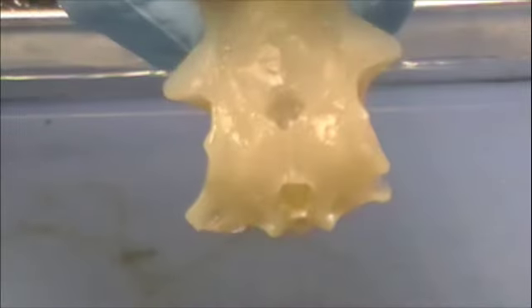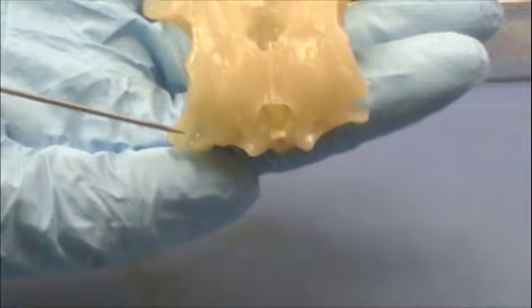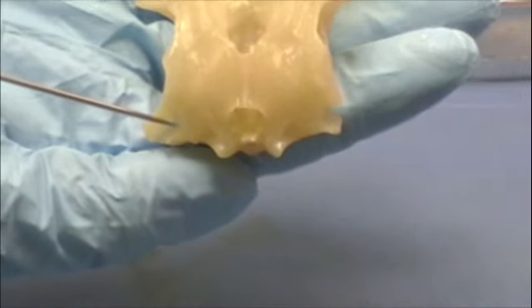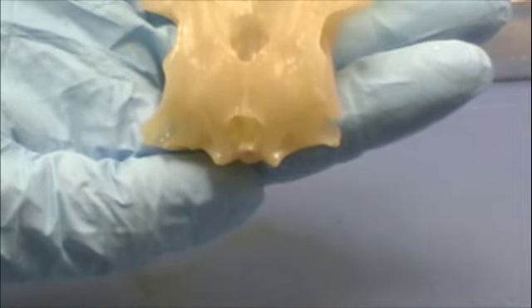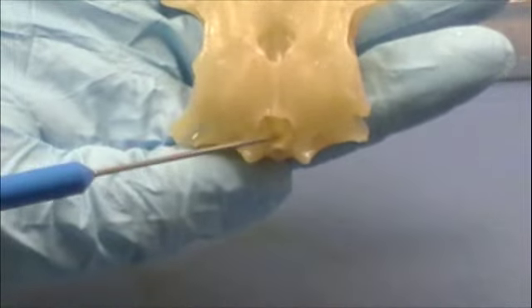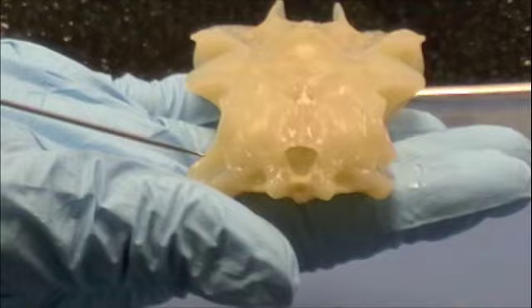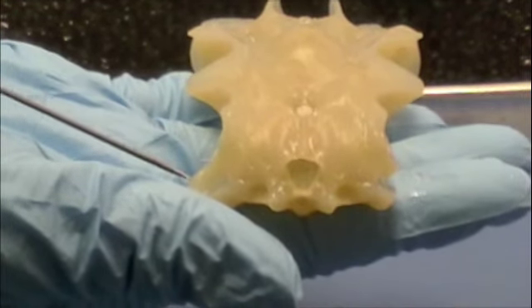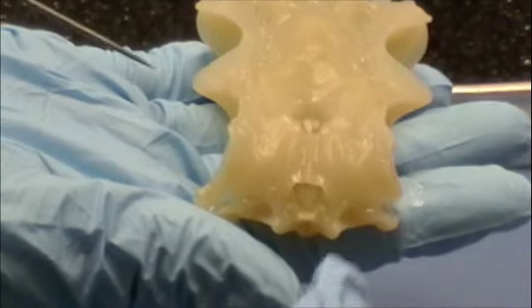I think this should be done. That's the otic capsule. And then the foramen magnum is this right here. Foramen magnum. The occipital condyles — the condyles.